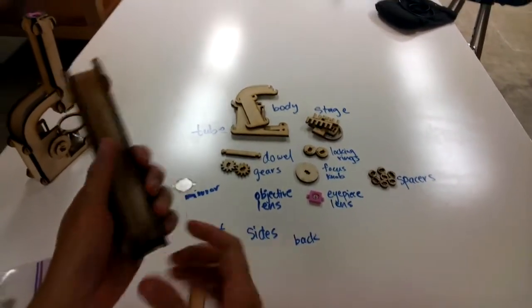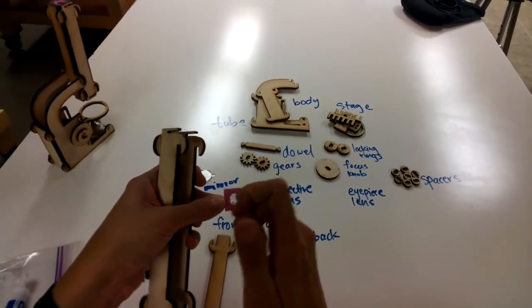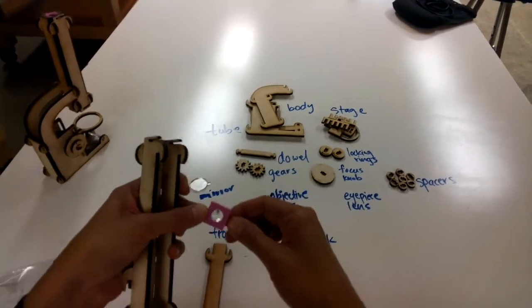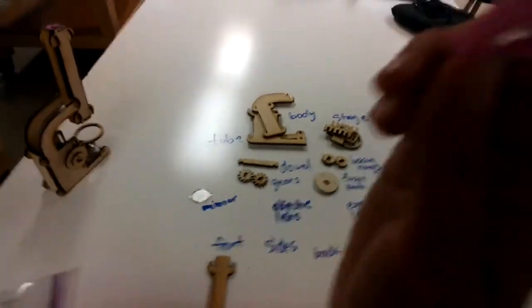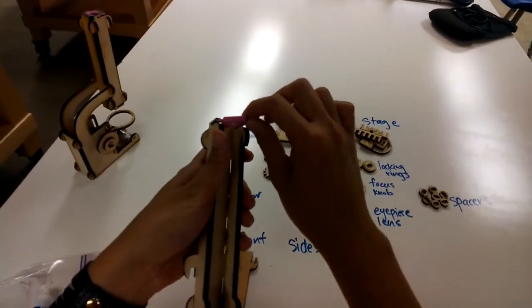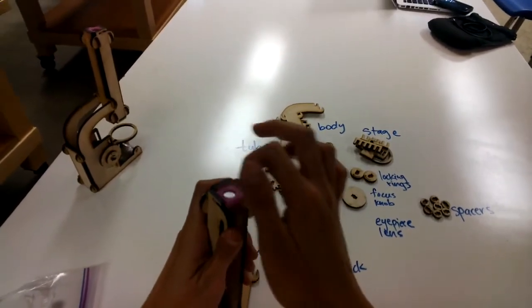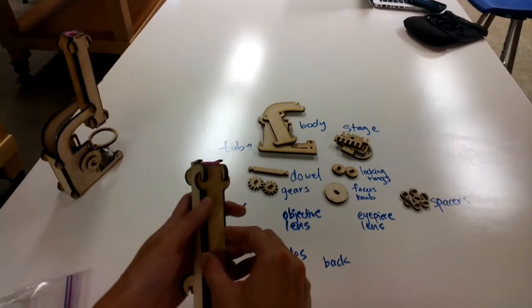Okay. And then for the eyepiece, that's your other lens. If you softly feel it, one side is flat and one side is curvy. You want the curvy side to be facing into the microscope tube. So you slot it on and make sure again that the top side here should be flat, and this side is curvy, and then you're ready to slot on the last piece on the front.